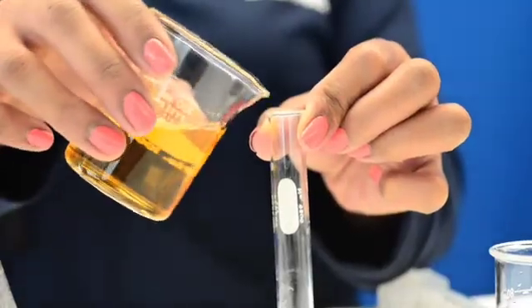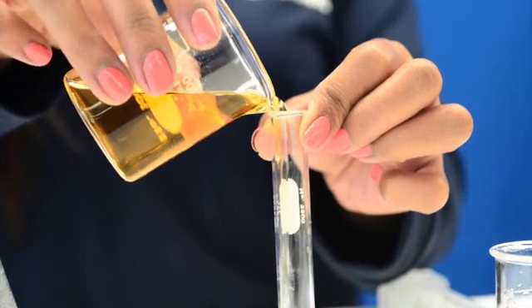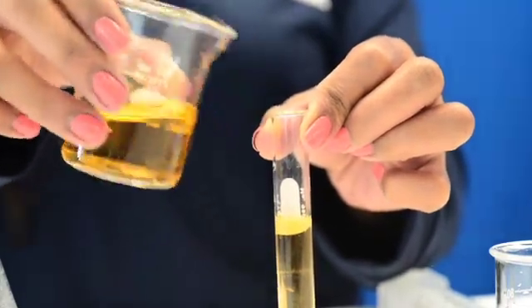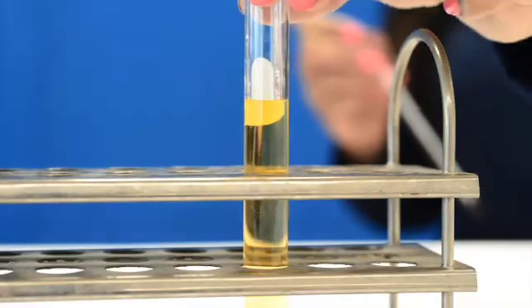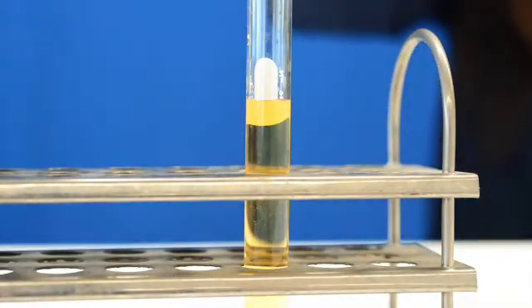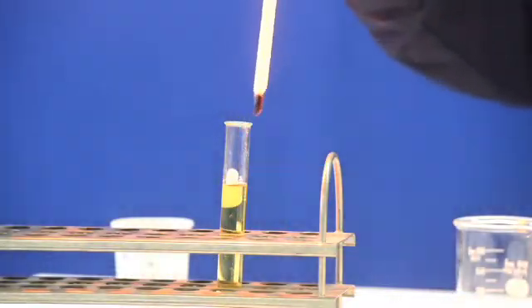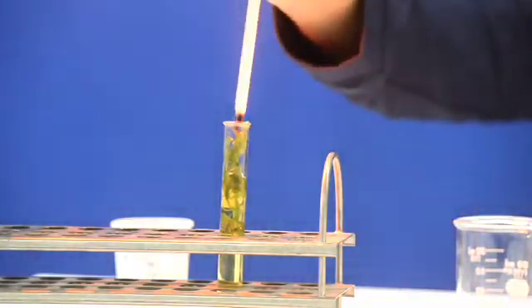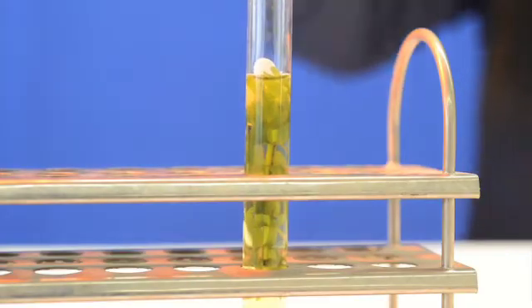Now that you have your acidic phenol red solution, fill your test tube 3 fourths full with the solution. Set the test tube with the solution and a thermometer at one of the lab stations. Once your solution has reached the appropriate temperature, submerge your sprig of Anacharis upside down into the test tube and see what will happen.